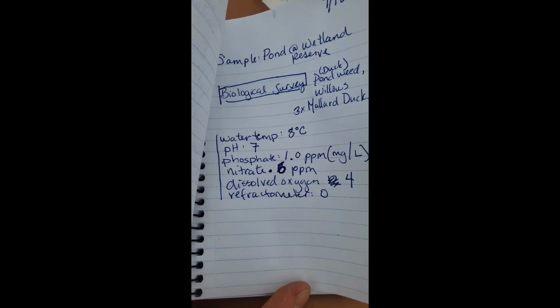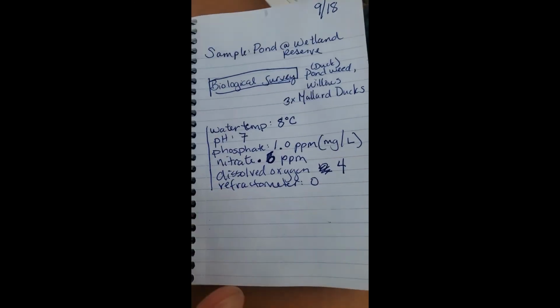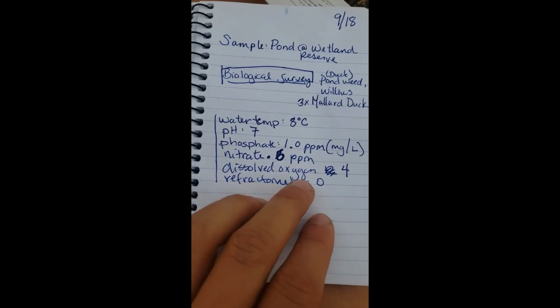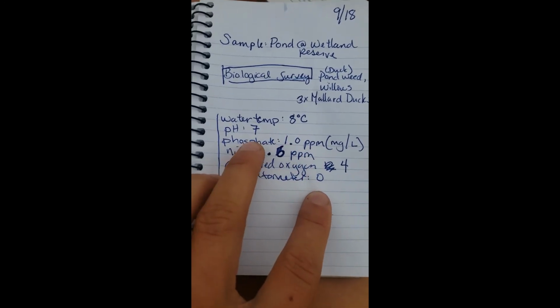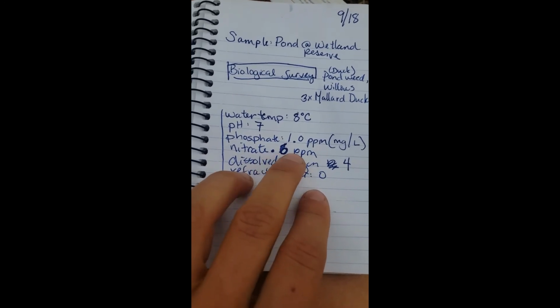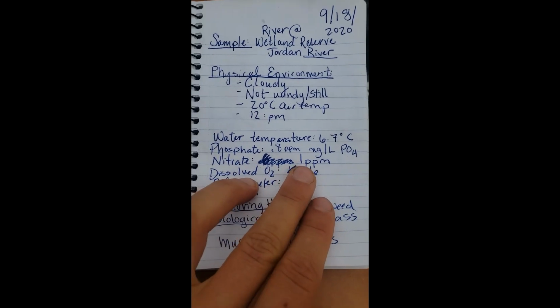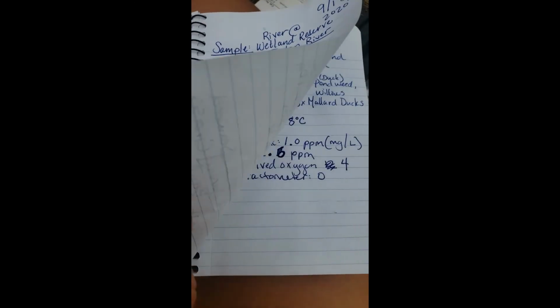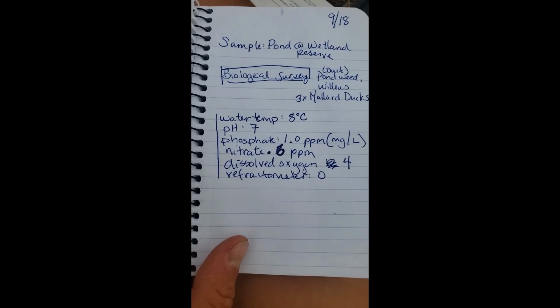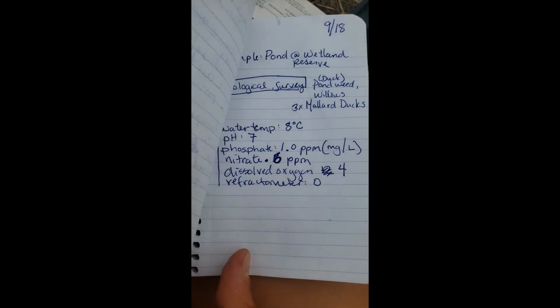And I would say from that conclusion, using Mitch's hypothesis that there might be more phosphorus and more nitrate, I actually want to go back and test this nitrate. Because here I'm actually questioning the sampling method, which is totally part of science. When you get some data, you can go back and retest and make sure it's reliable. And I want to make sure that that nitrate level is right.